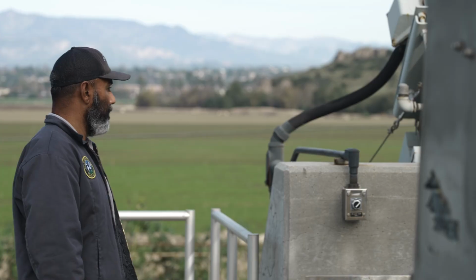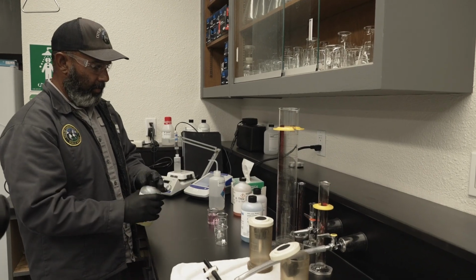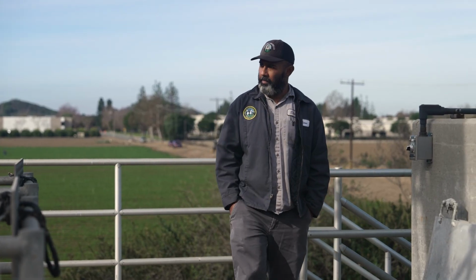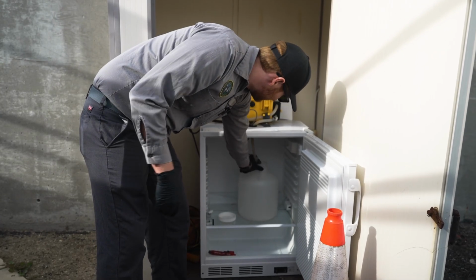Shane, what do you like about working in the laboratory? Working in the lab and at the reclamation plant in general makes you feel like you're making a worthwhile contribution to the community. It's like one big family here, and it feels good protecting the environment. Working in the lab's fun. There's always interesting or niche problems to solve, and you get to do a little bit of everything. There's always some new piece of equipment, new method, or new regulatory requirement to learn about. At the end of the day, you're providing a much needed service to the community.